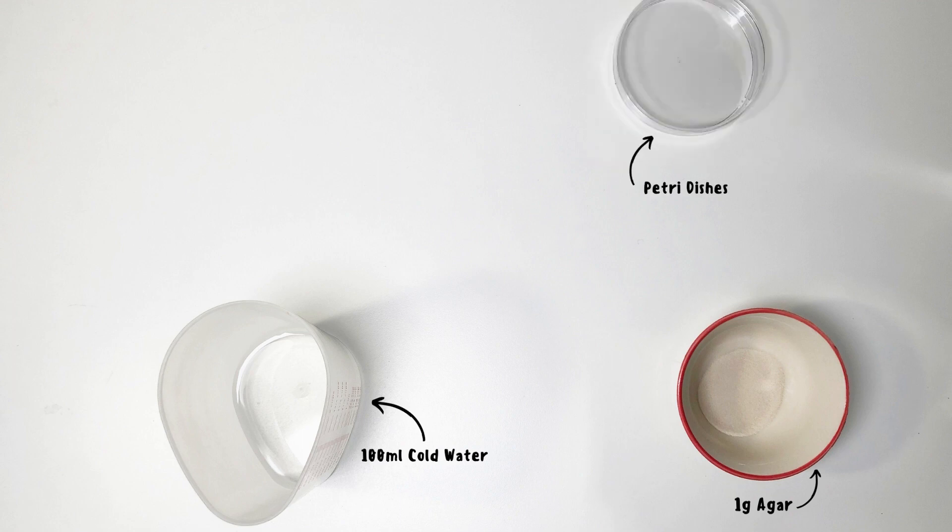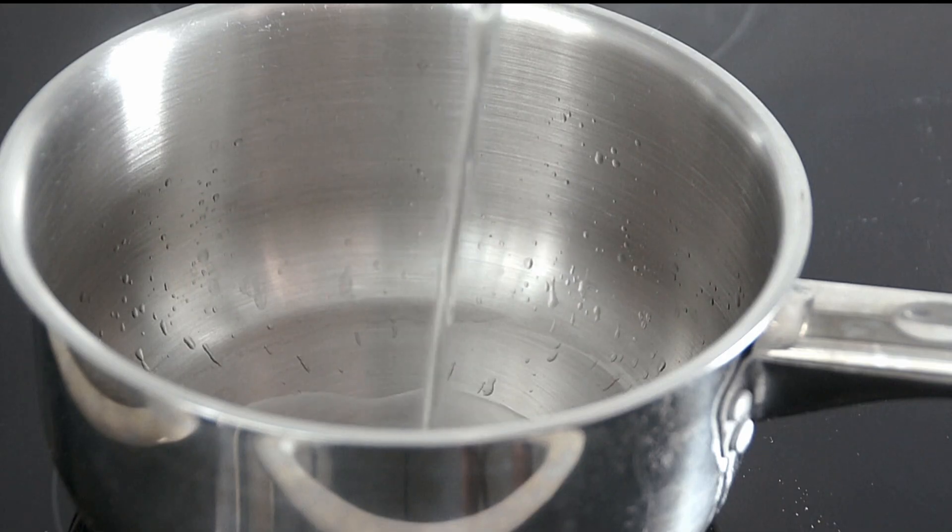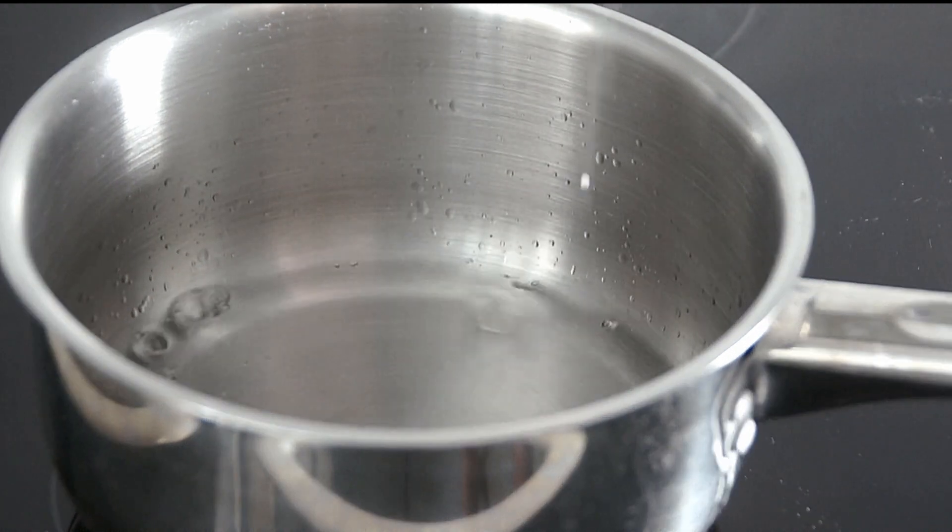These are all the tools and ingredients you need. Start by mixing your agar and your water in a medium-sized pot.